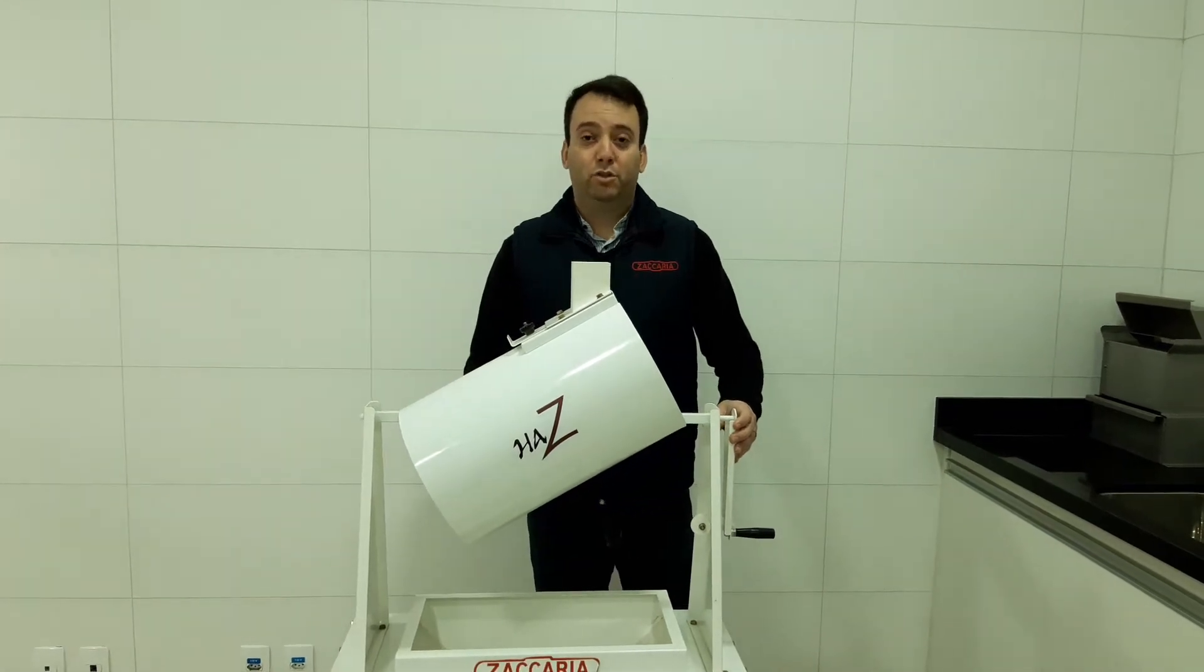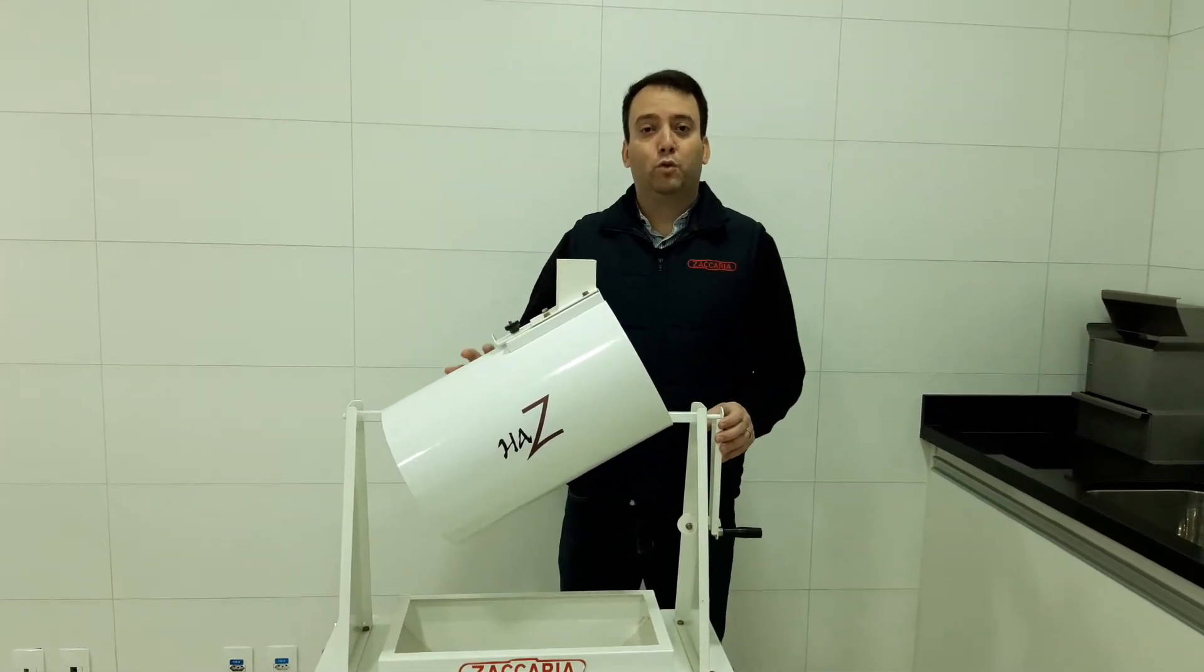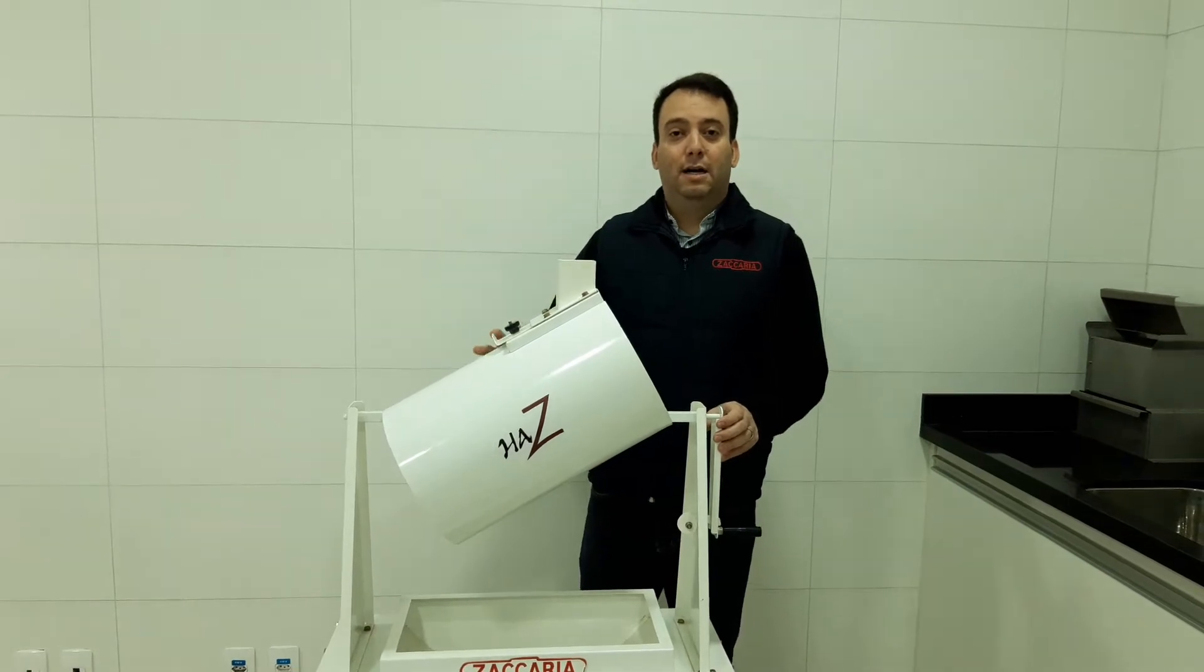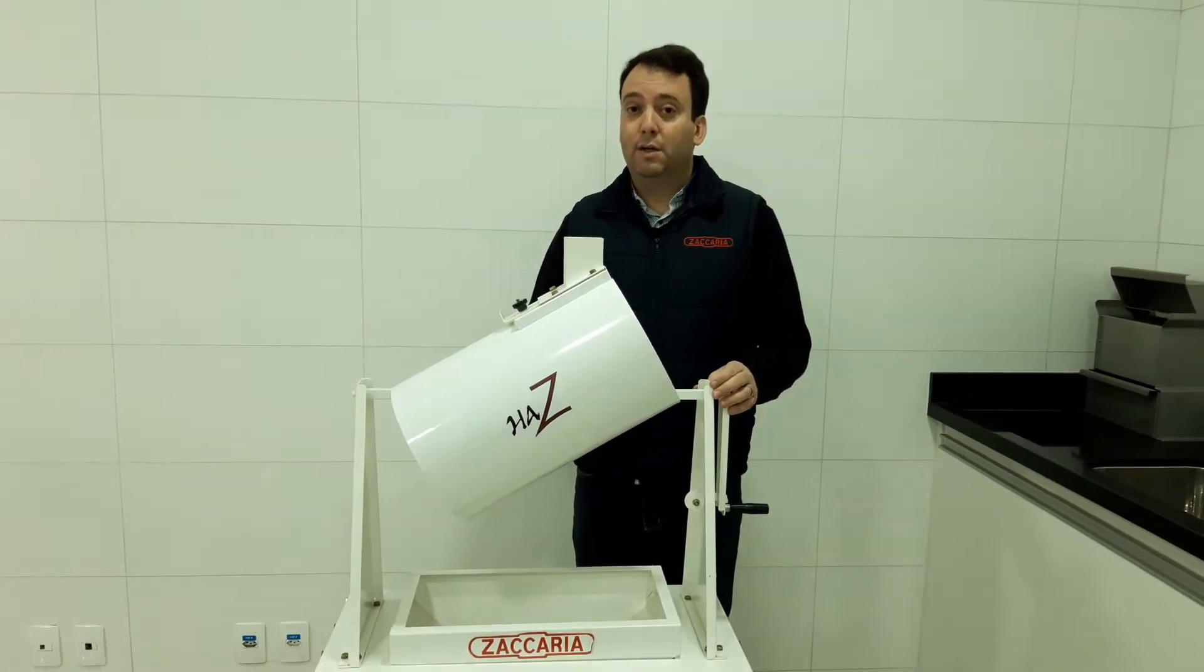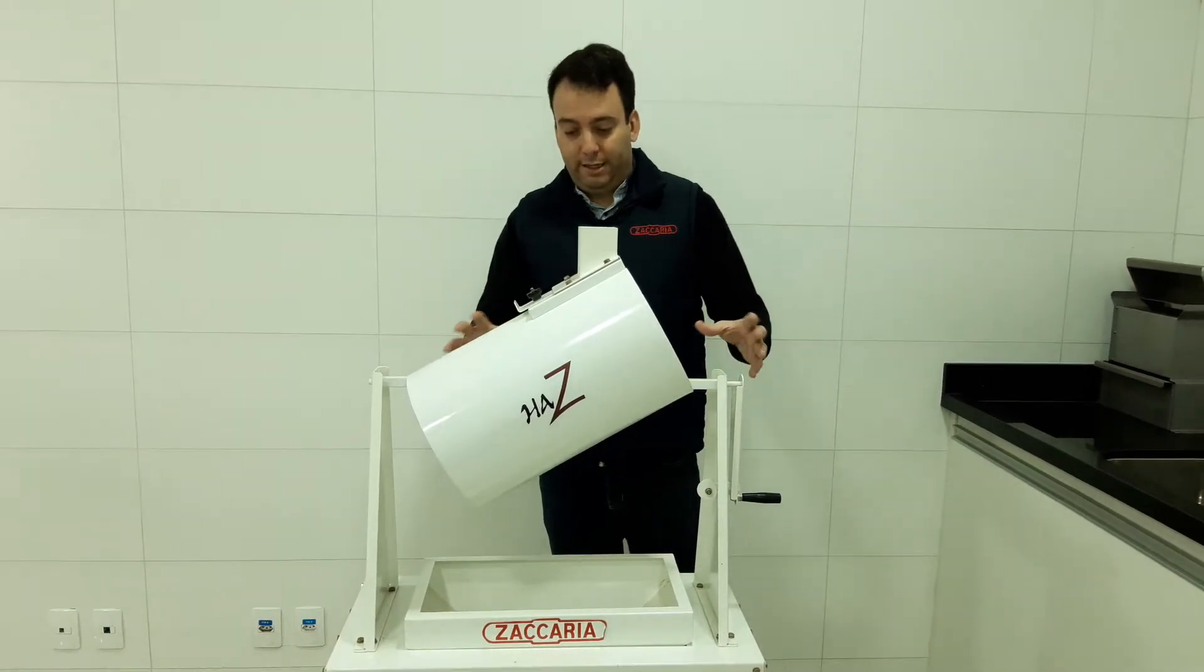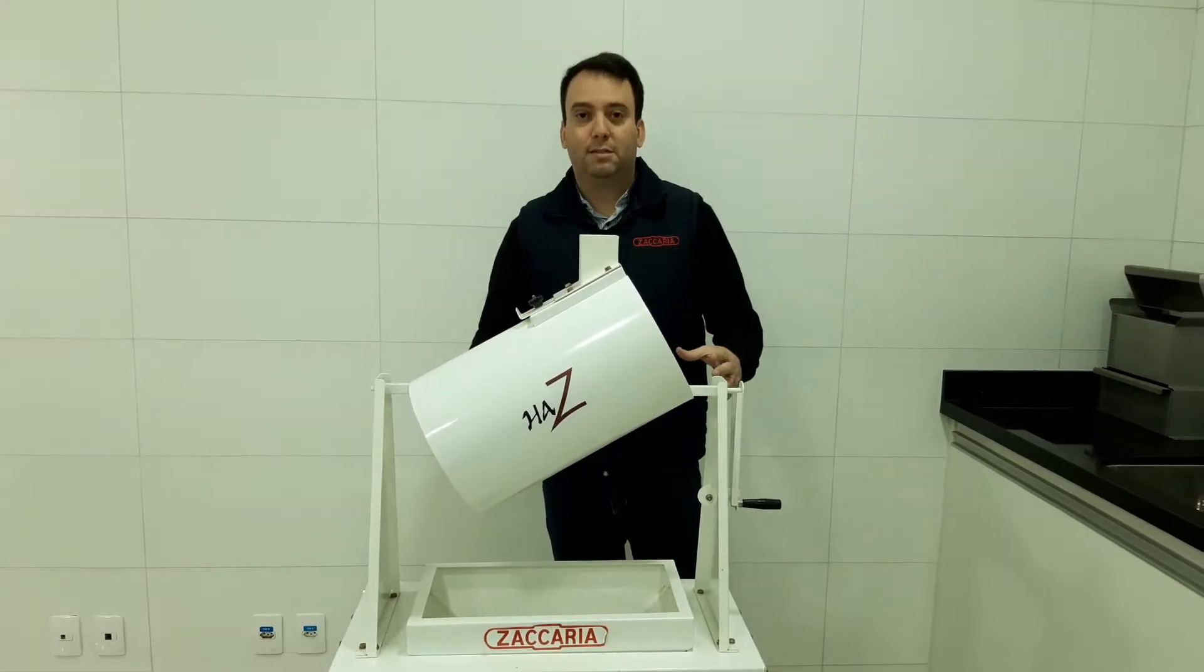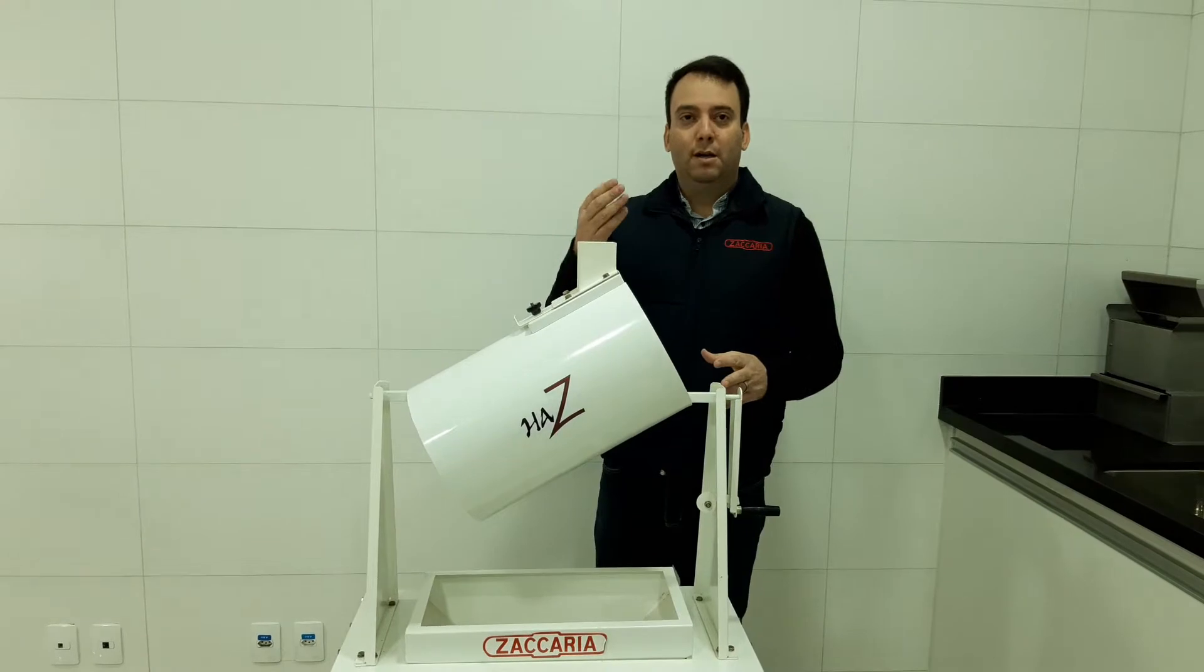I'm here today to demonstrate how to make a full lab test from paddy until white rice. This is our homogenizer equipment to homogenize the paddy before the test.